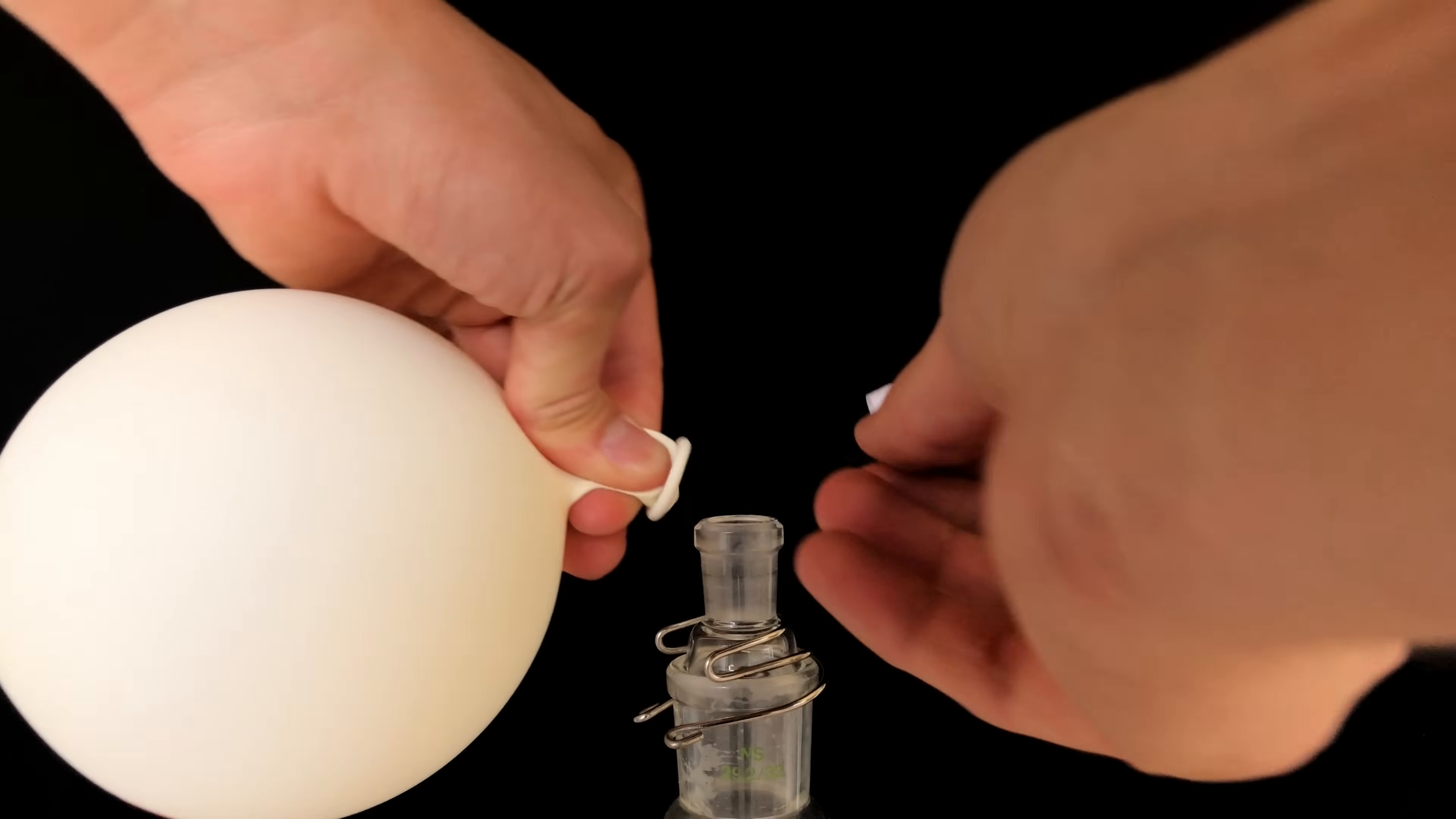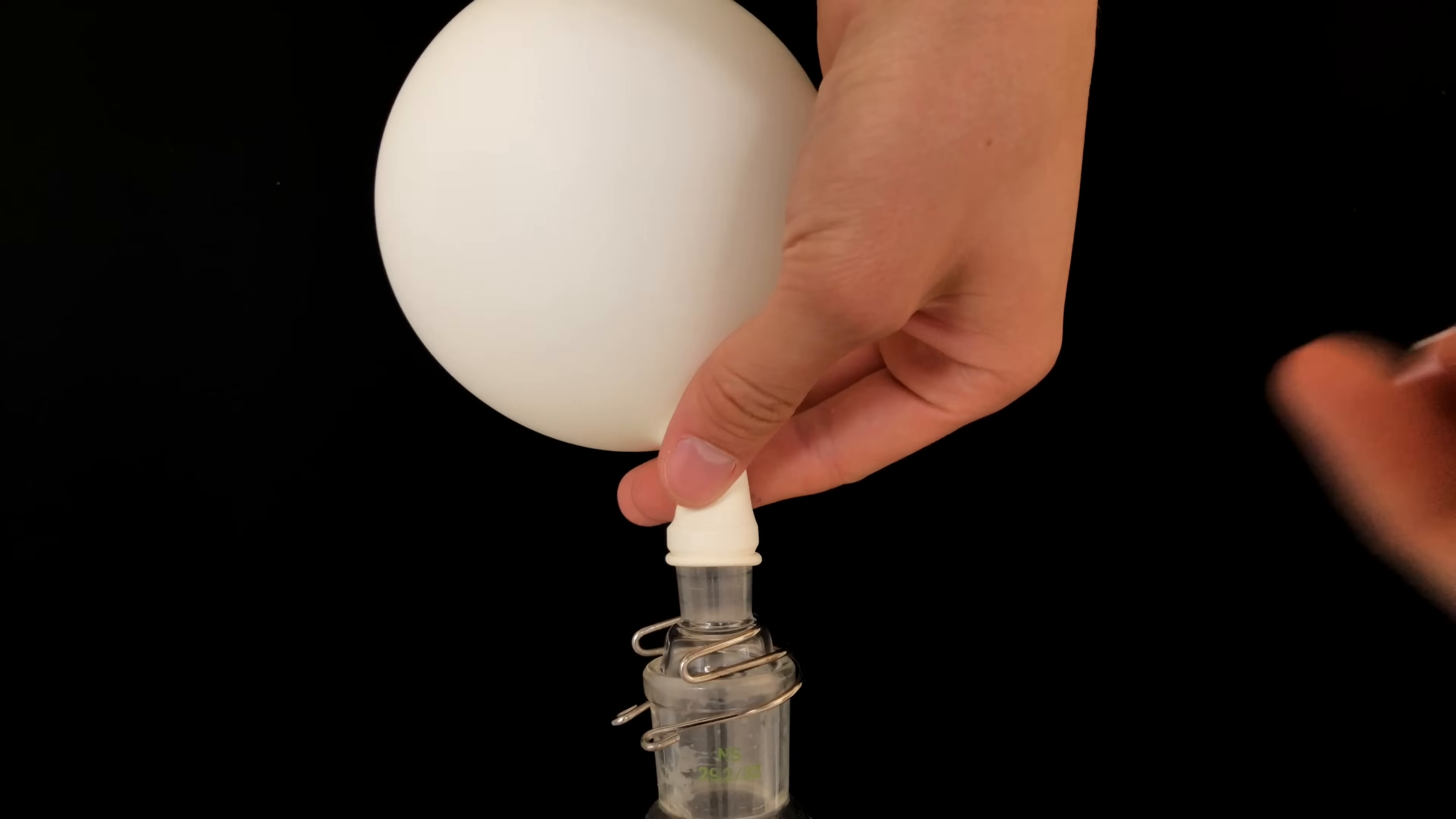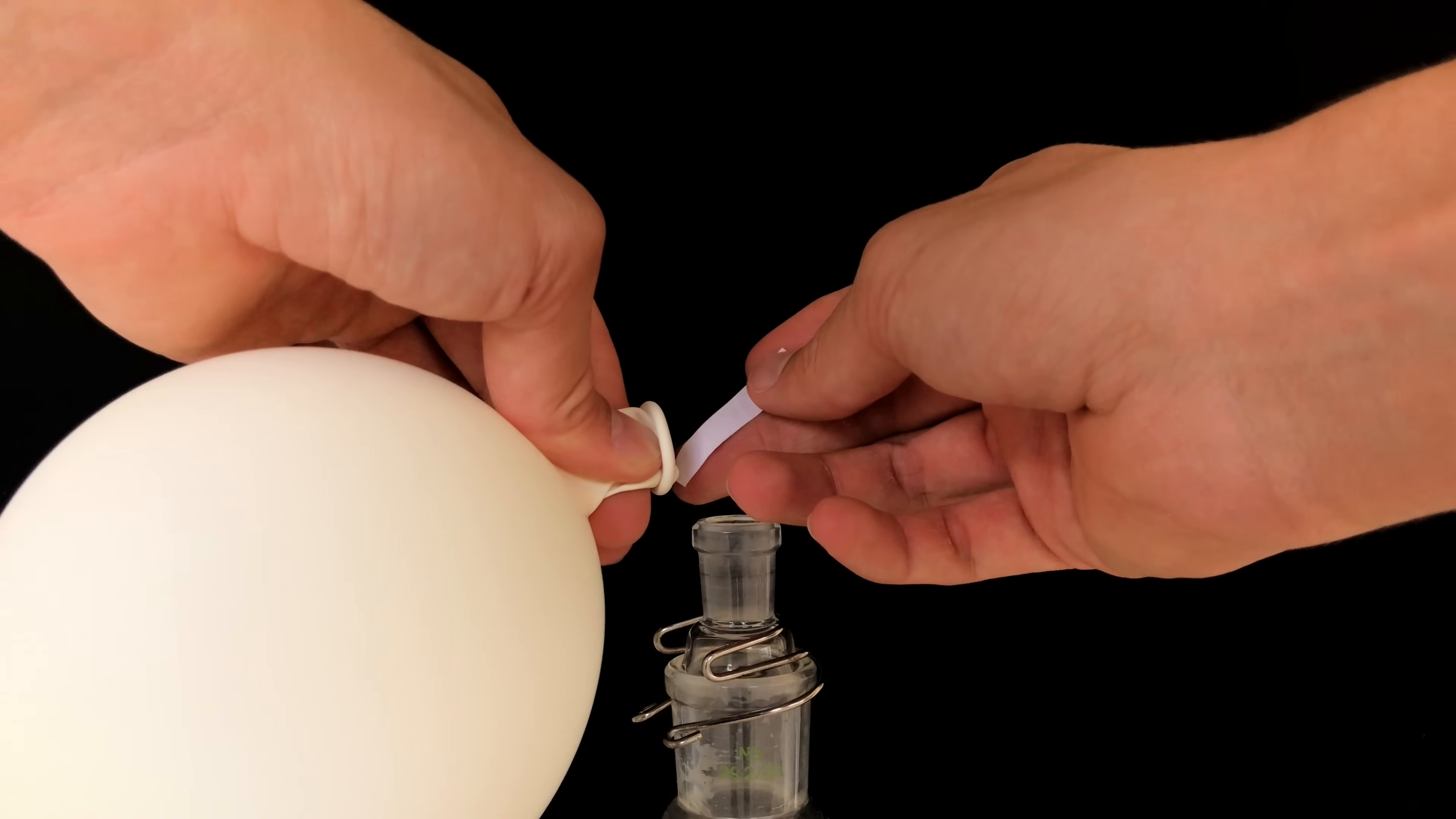Do not inhale the laughing gas made via this process. I smelled it and it smells like nitrogen dioxide. Only a little, so I tried to test for it using potassium iodide starch paper which turned out negative. Smell remains a better indicator for nitrogen dioxide than the crude method I showed you.